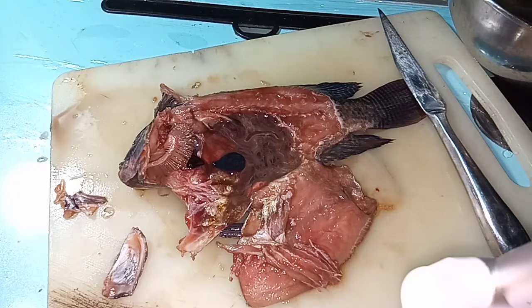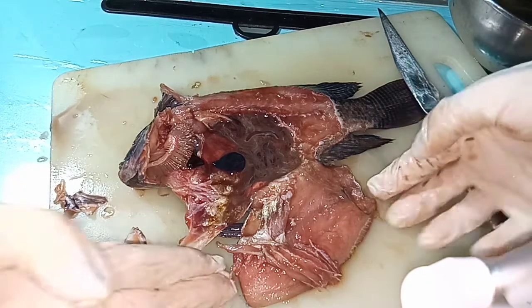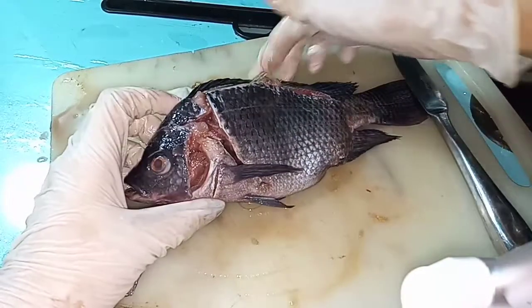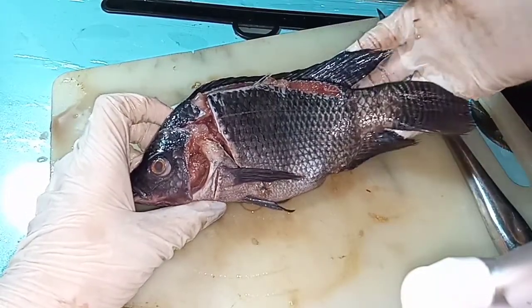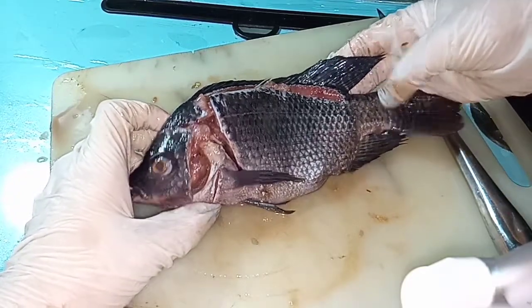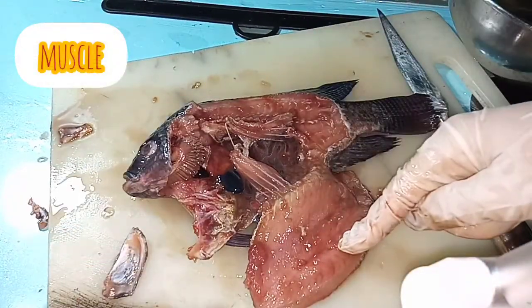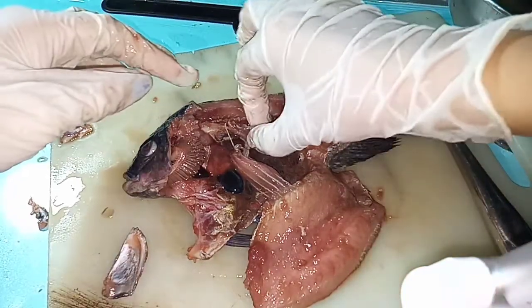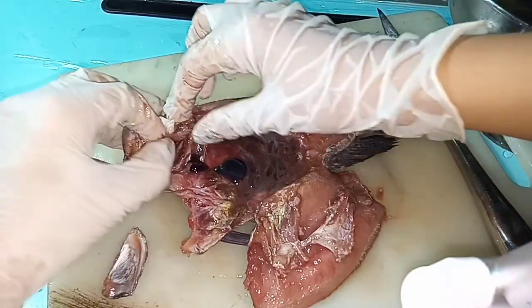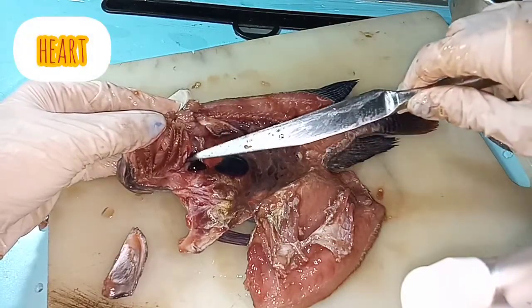Now, for the internal part of the tilapia, I've already cut it — but this is how it looks like. This is the tilapia in the external figure. Now, for the internal organs: first, we could see that this is the muscle. Next, here we could see the gills. And this part — this is the heart of the fish. It's only small.